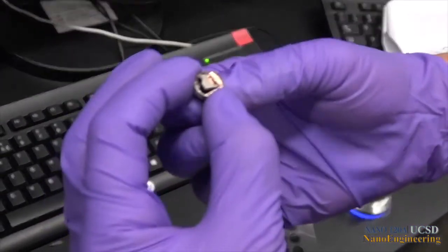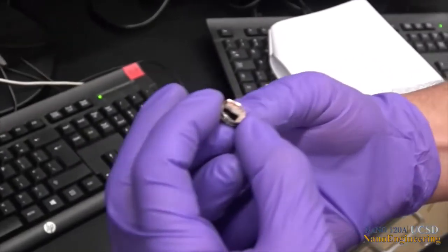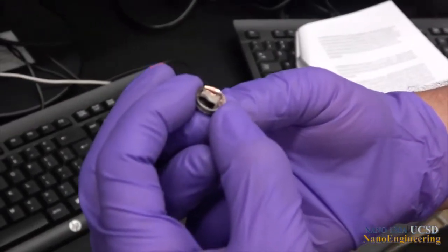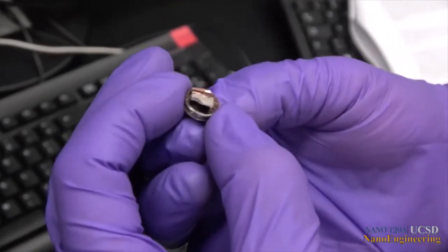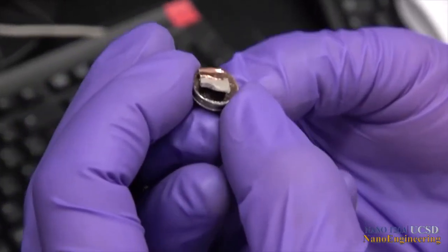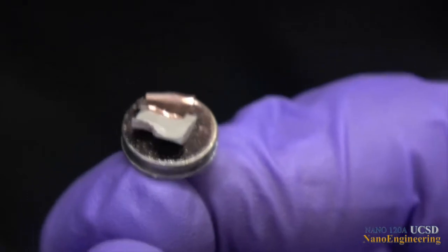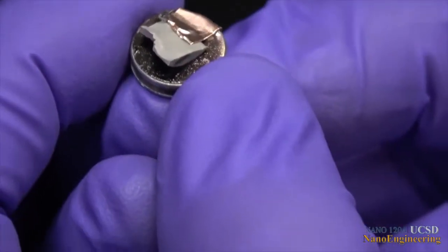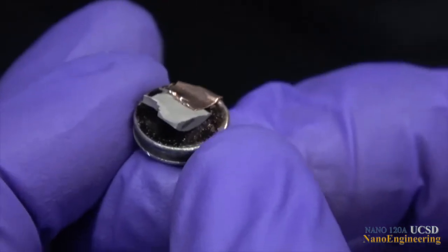This ceramic surface was lightly coated with a thin layer of sputtered gold to assist with electrical conduction during analysis. A piece of copper tape is also used to secure the sample to the specimen mount and to provide better electrical conduction to the mount to reduce charging of the sample.